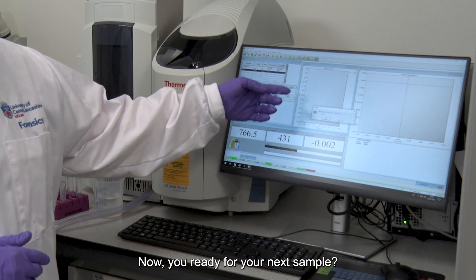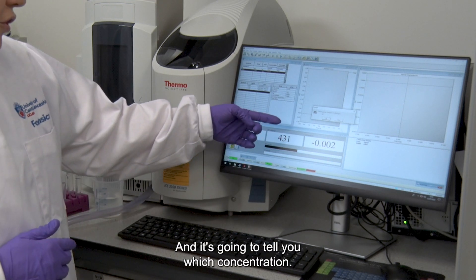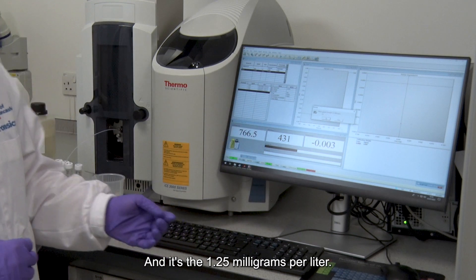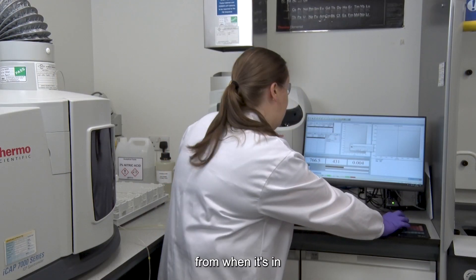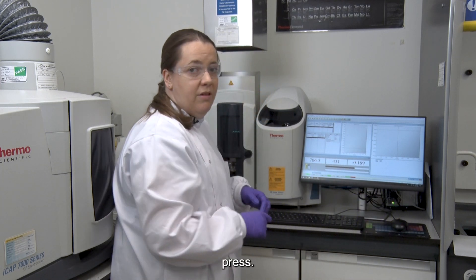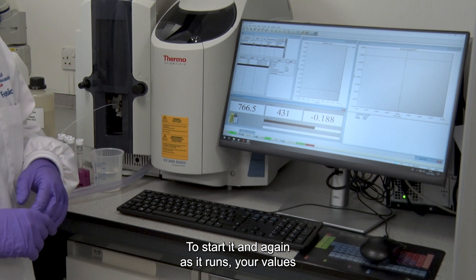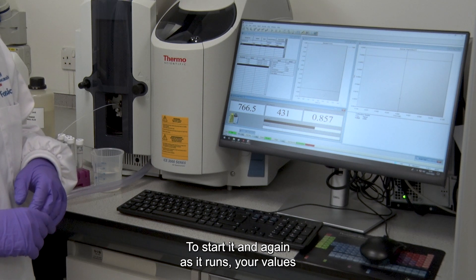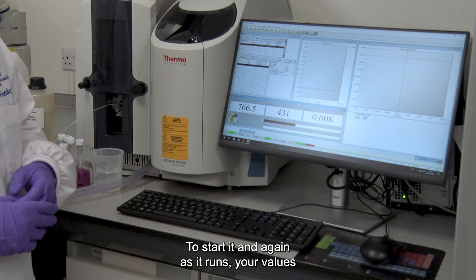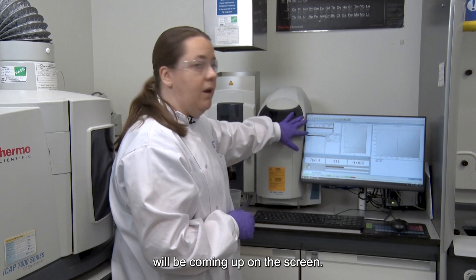Now you're ready for your next sample and it's going to tell you which concentration — it's the 1.25 milligrams per litre. Then when it's in, press OK to start it. Again, as it runs, your values will be coming up on the screen.